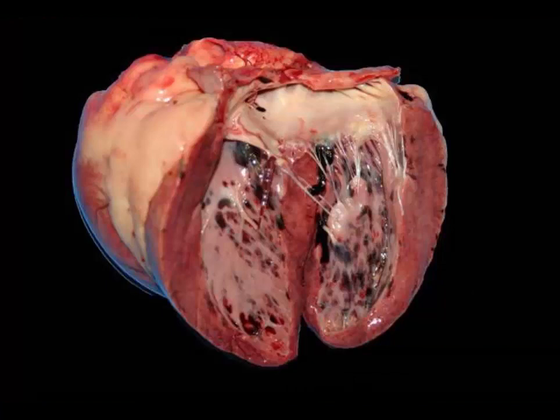This is an absolutely fantastic slide by Santiago Diab, I think when he was at the California Animal Health and Food Safety System. And I'm going to ask you to name the condition and give me a pathogenesis.